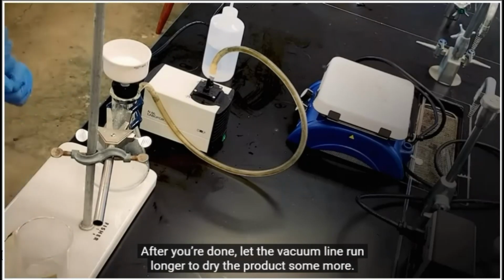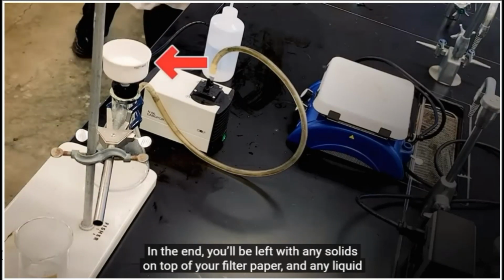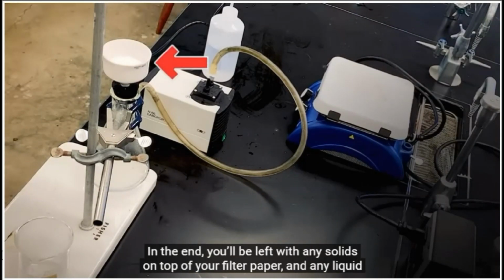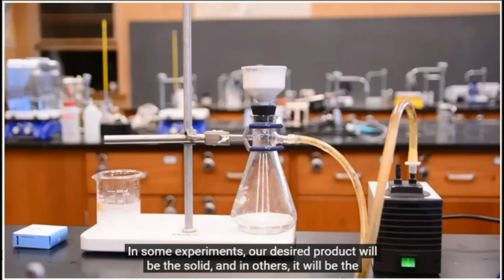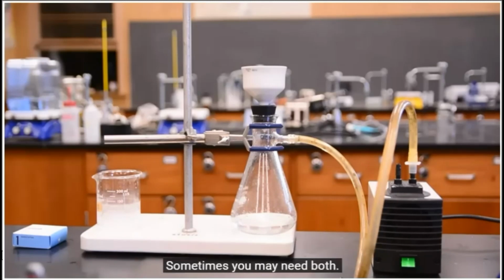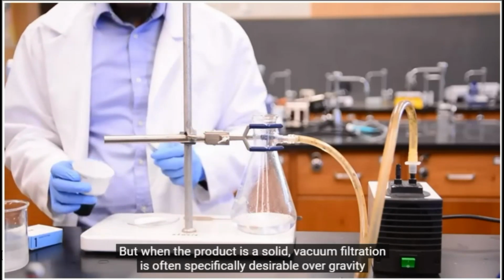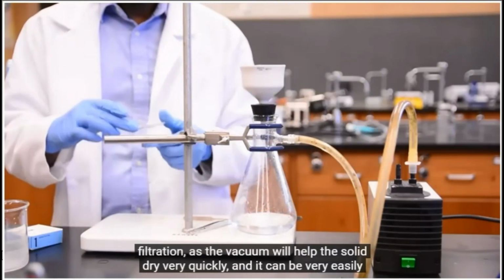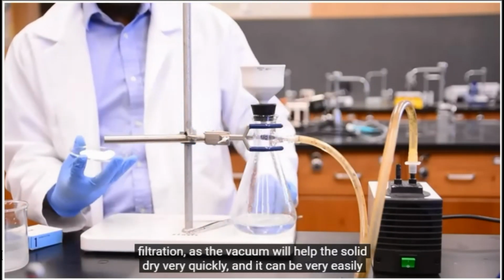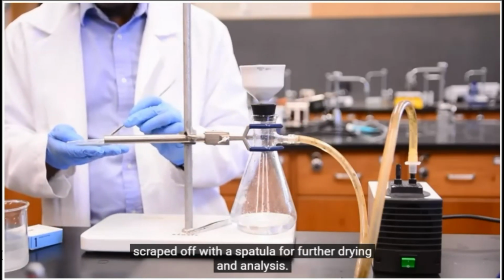After you're done, let the vacuum line run longer to dry the product some more. In the end, you'll be left with any solids on top of your filter paper and any liquid in your Buchner flask. In some experiments, our desired product will be the solid, and in others it will be the liquid filtrate. Sometimes you may need both. But when the product is a solid, vacuum filtration is often specifically desirable over gravity filtration, as the vacuum will help the solid dry very quickly, and it can be very easily scraped off with a spatula for further drying and analysis.